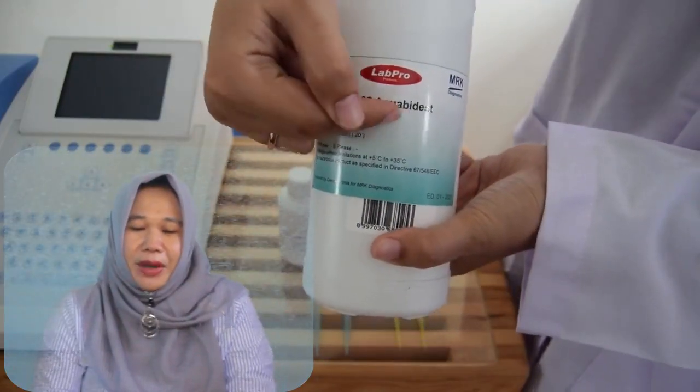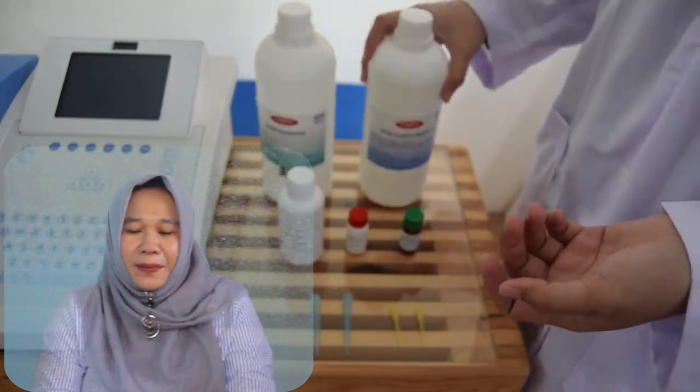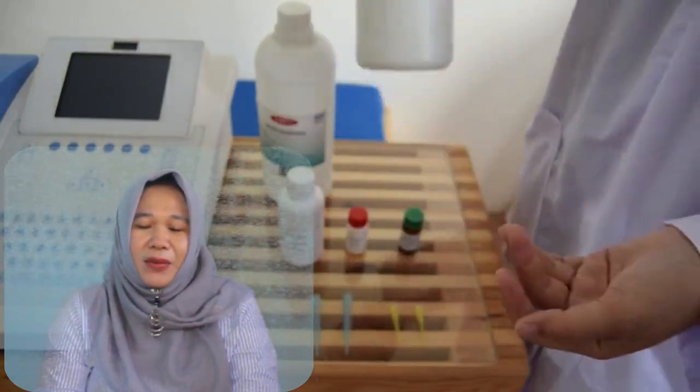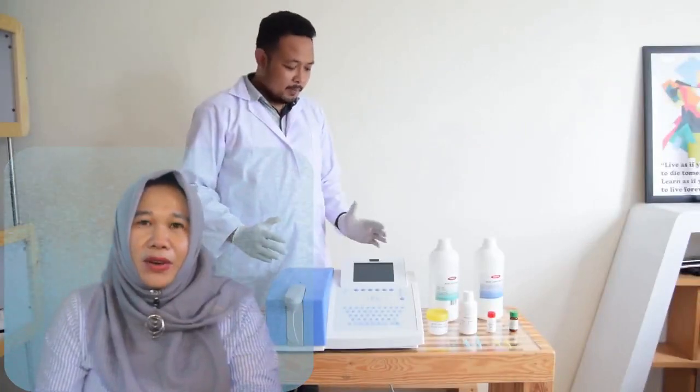That is what makes the difference. The new Microlab 300 extends the excellent reputation of the Microlab family, with thousands of users all over the world.